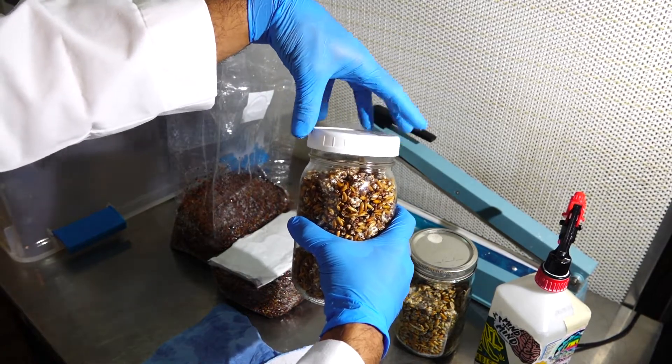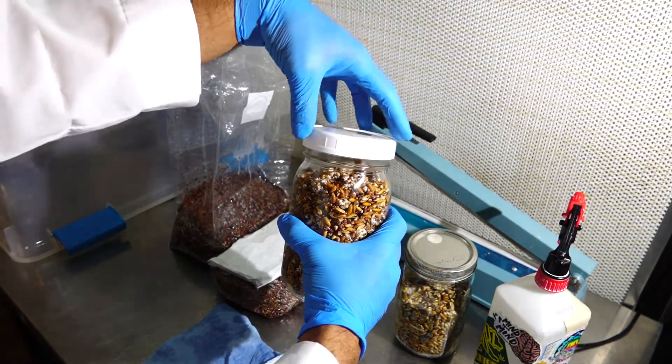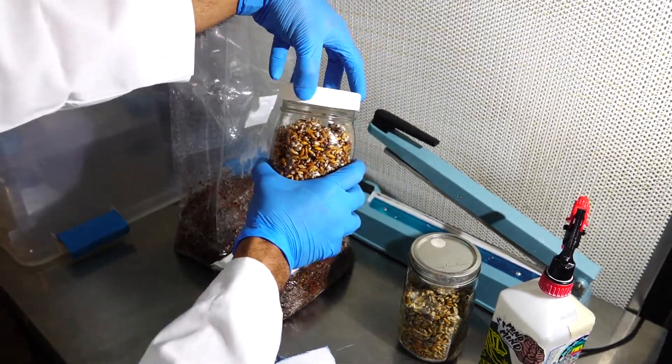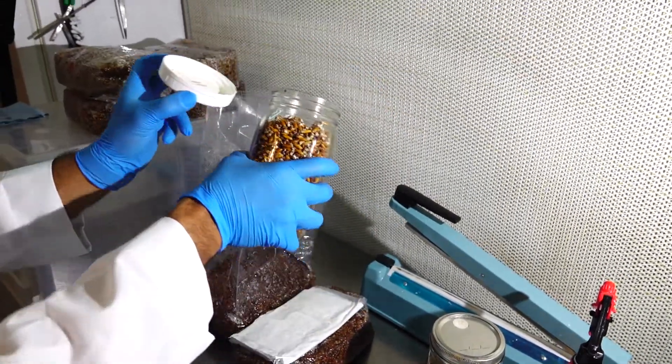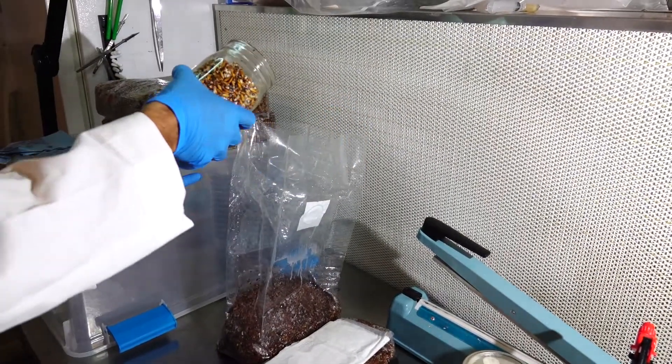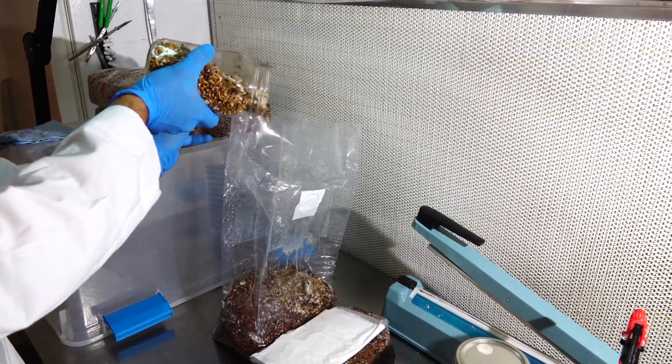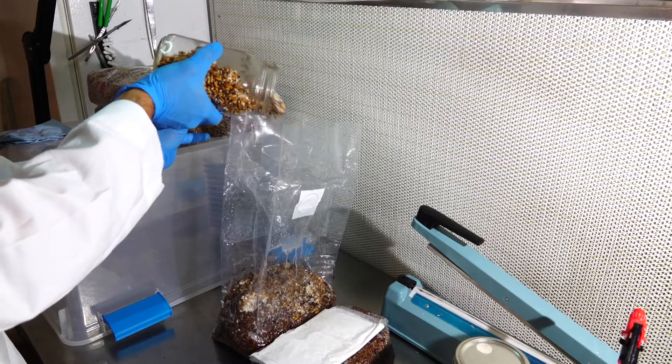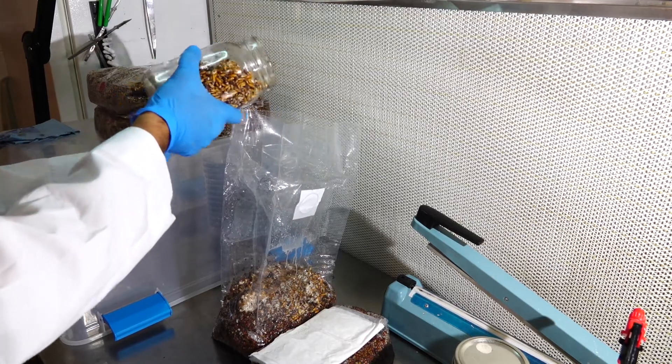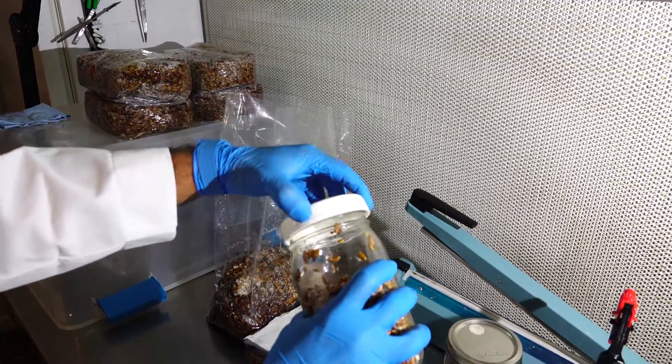I will be transferring about a quarter of the jar into the bag. Also, when removing the lid off of your jar, you want to make sure that you never actually place your hands over the opening of the jar. So very quickly I will lift the jar, holding it with my second hand, and then pour in a generous amount and then quickly reseal my jar.